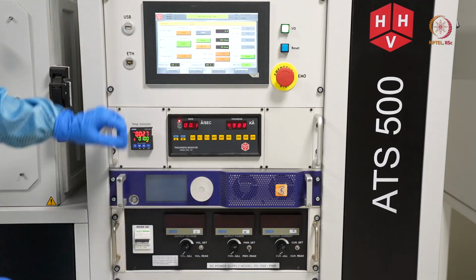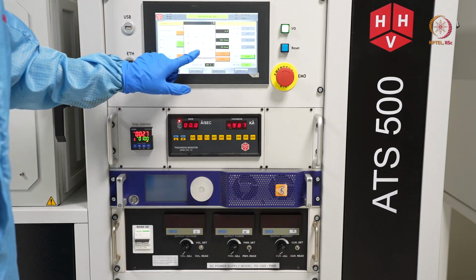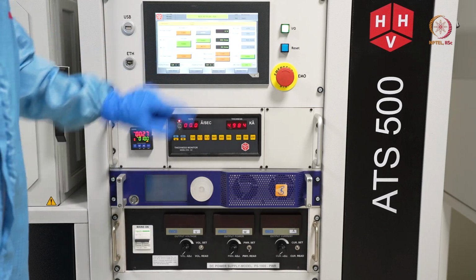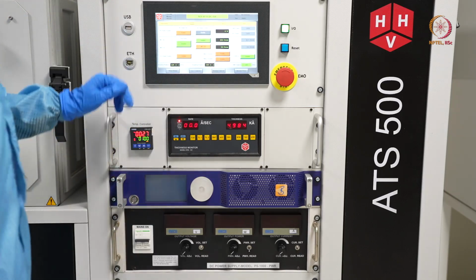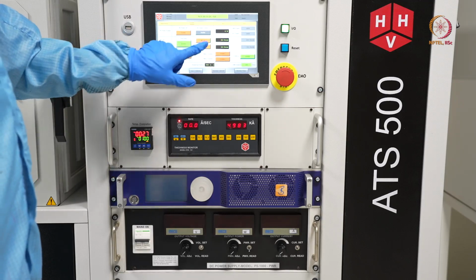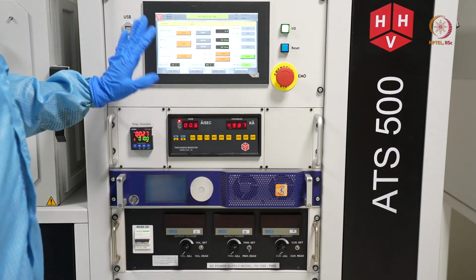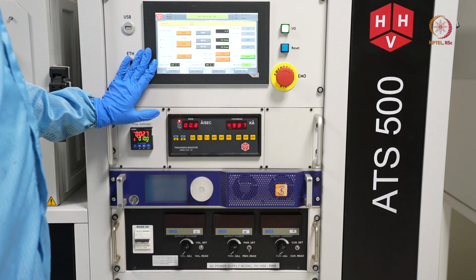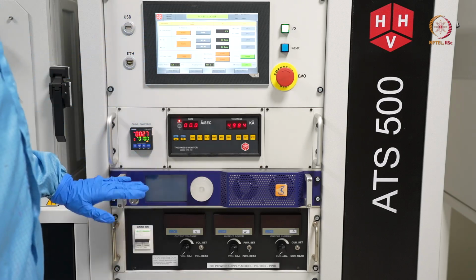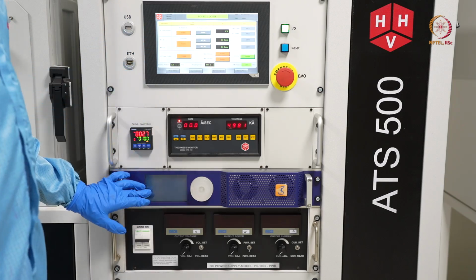Here, the gas flow, we can reduce it a little bit, or we will just reduce it to 20 where it was. After that we can switch off this argon supply also, disable and disable. So this will switch off the MFC part. So this is everything that comes under one deposition of DC sputtering. After this, on the same sample, we will show you the RF sputtering as well.